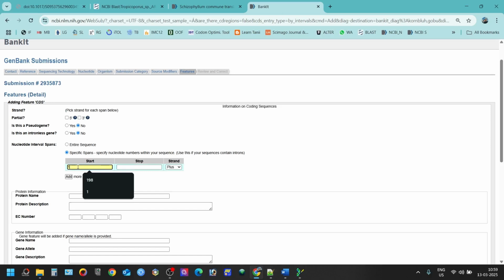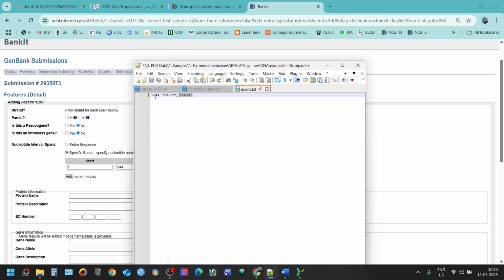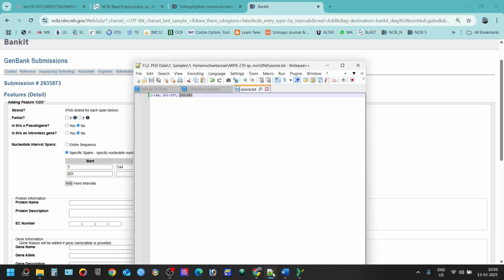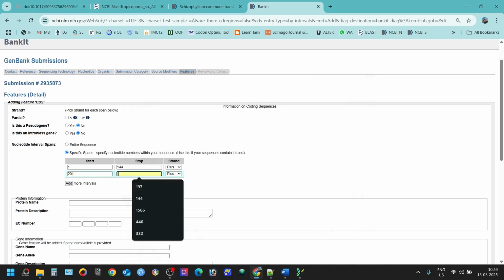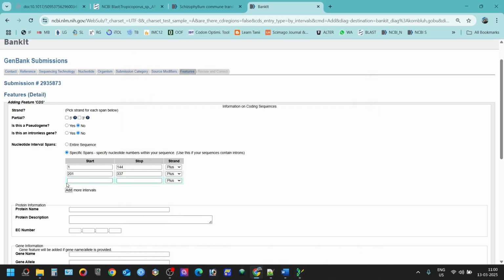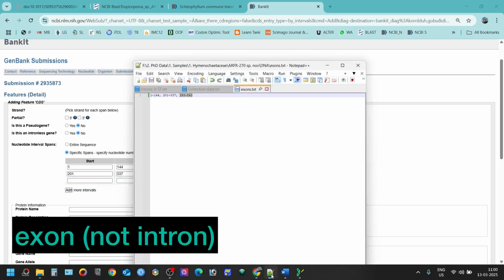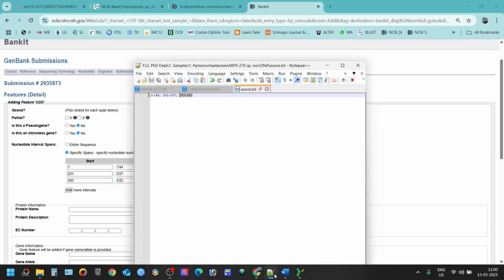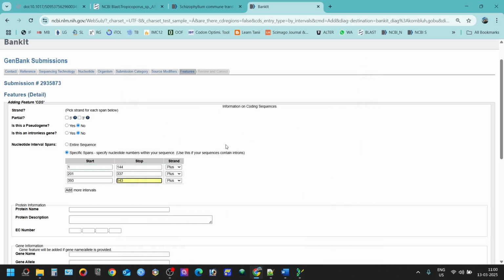For example, 1 to 144, it's exons. You can see here, it's 1 to 144, it's your exons. From 201 to 337, and then the next exon is from 393 to 543. Now we are done with specifying the exons.